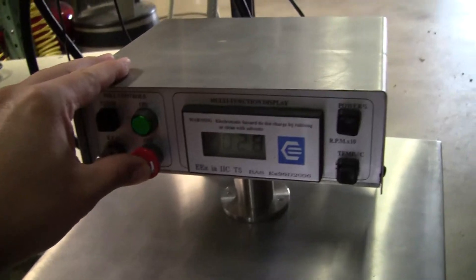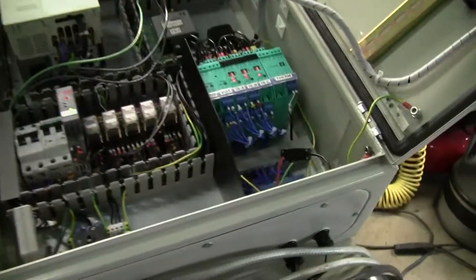I'm going to turn the unit off. I want to take a brief look at the control box which we've wired up.